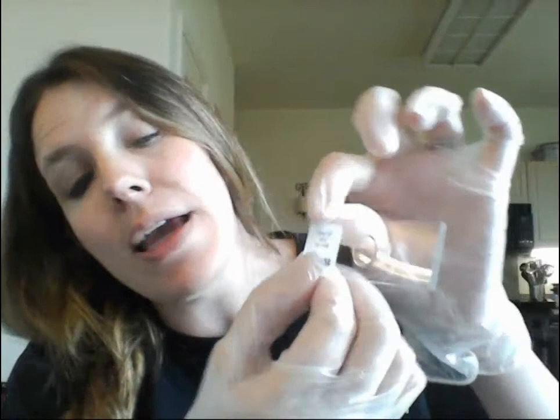You want to make sure you're looking at the label right-side up. Notice the orientation of the E before you put it on the scope — on my slide it's upside down, but yours might be different. You'll be recording what your initial orientation of that E is.